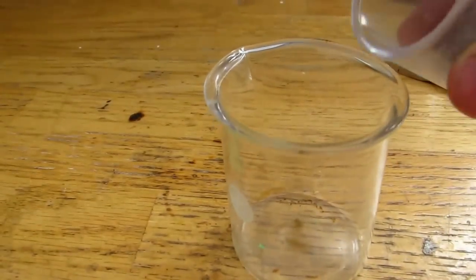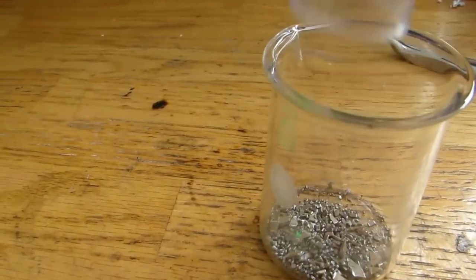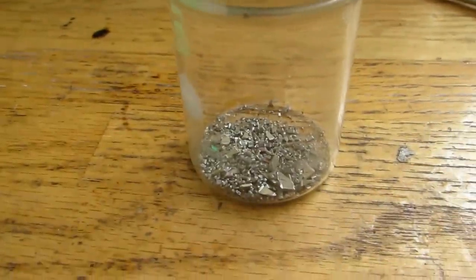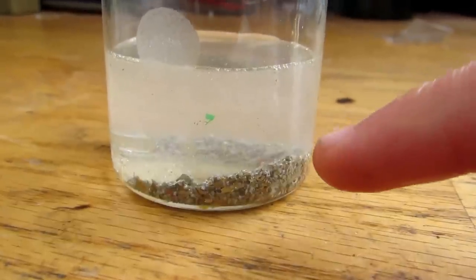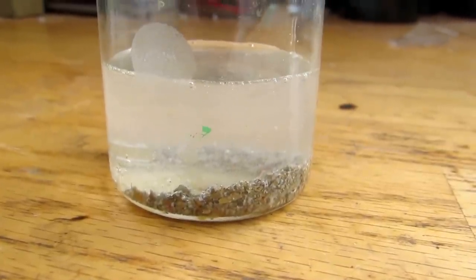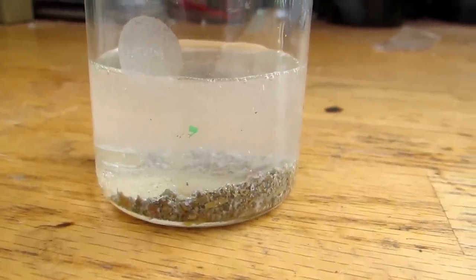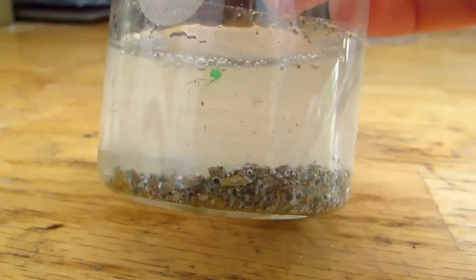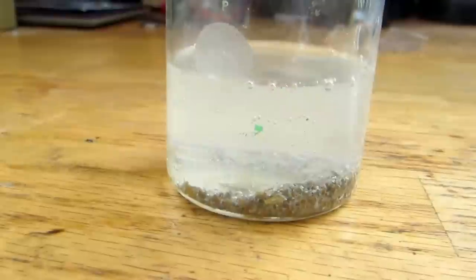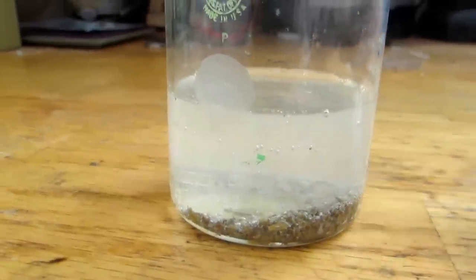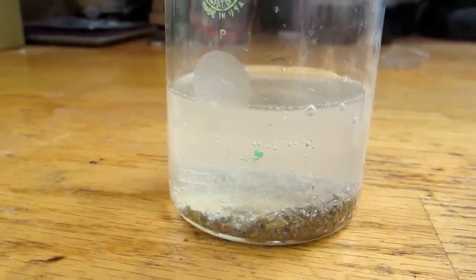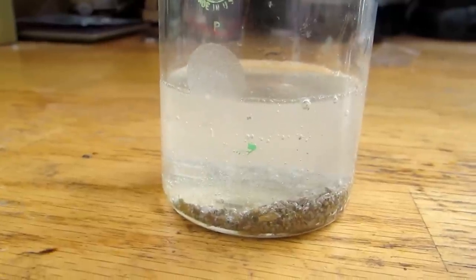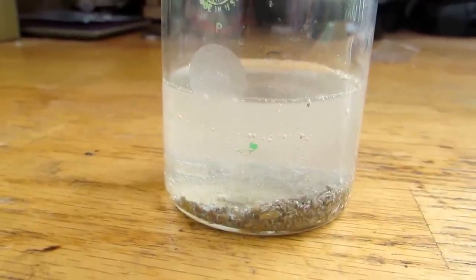Anyhow, other than that, we're just going to add in some hydrochloric acid, and put these in a separate jar too, and wait probably about half a week to a week, and that'll give us a good enough time to get a good dissolving rate off. So, I'll add them to this small beaker here, and I'll add in the hydrochloric acid and be back in a moment. Okay, so you can see there's a generous amount of bubbling occurring, and this is as it dissolves into solution, any of the soluble material in the hydrochloric acid. So I'm just going to let that sit there, probably up on my shelf, for about half a week to a week, and then we'll see what we get.